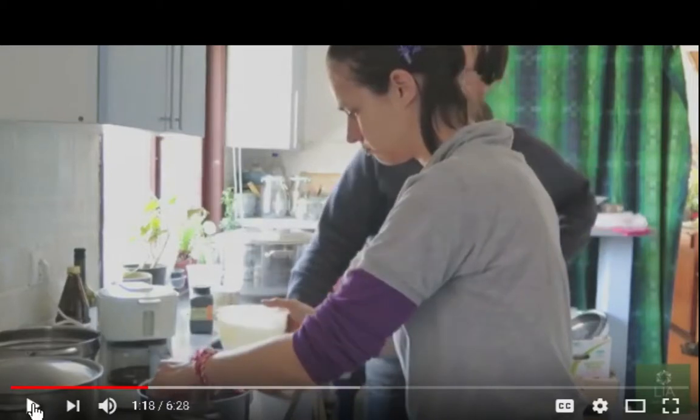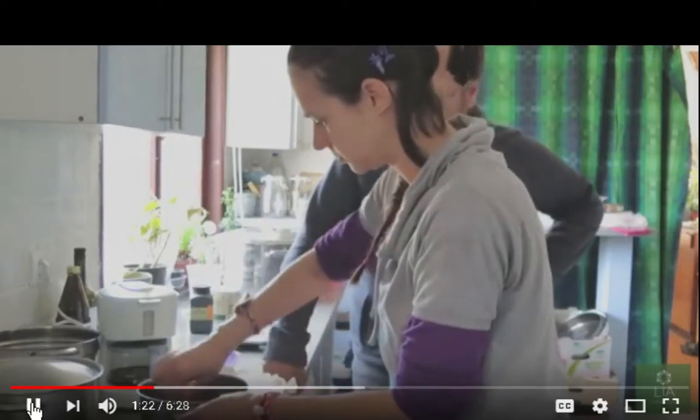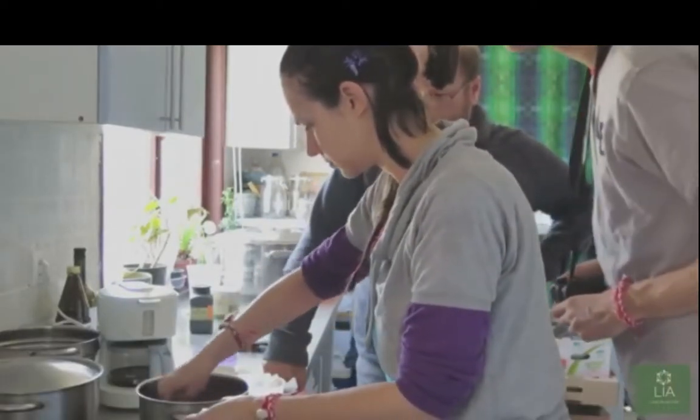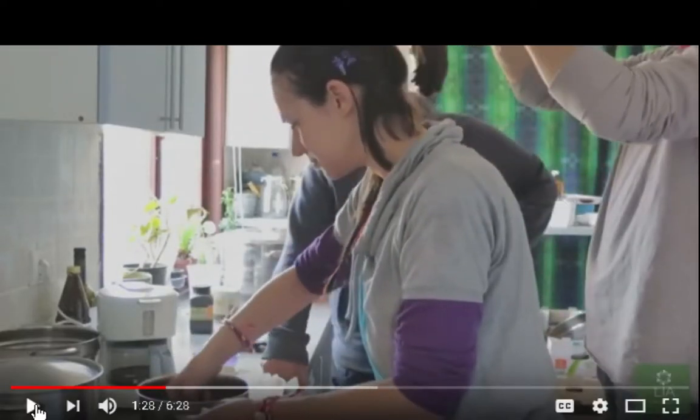Okay, so adding the agar, I guess. I don't know if that's what she did, but if you add that slowly, it doesn't lump up. I guess the solution's already warm. Or is it? I don't know. That's a question because the videos that I follow, the potato dextrose solution is just boiled and then filtered, and then the agar is added to the hot solution slowly so it doesn't clump up.